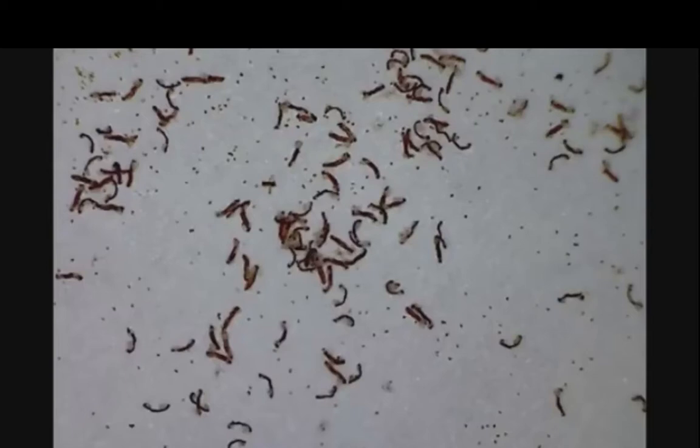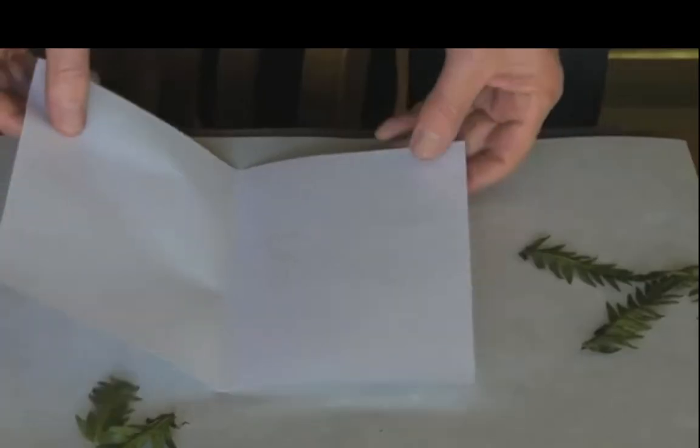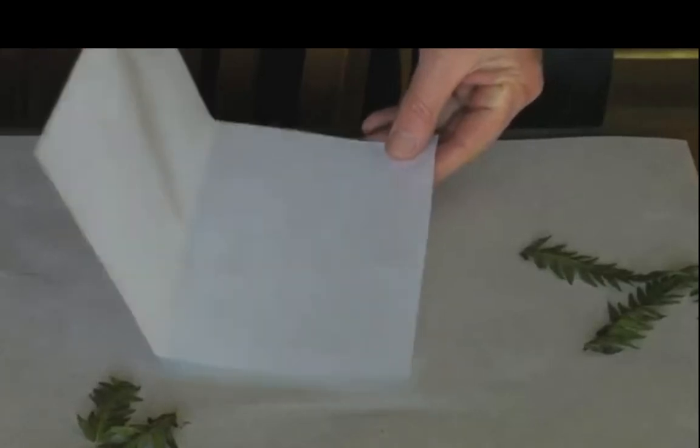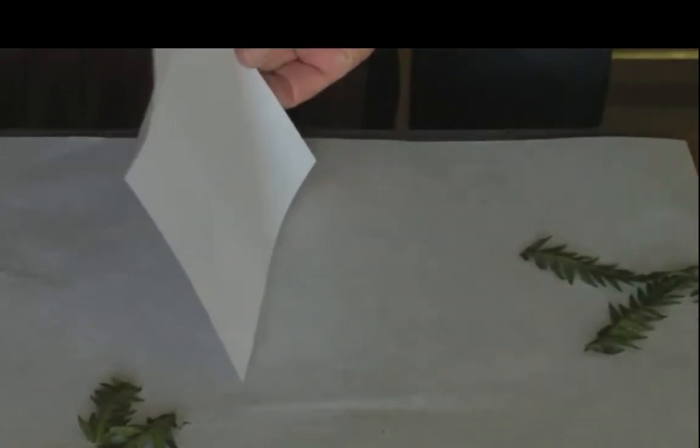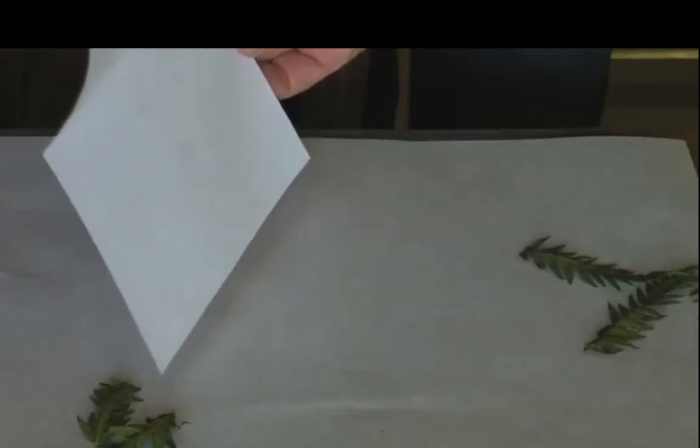Now if you look at the dust under a microscope, you'll see that much of it is spent sporangia, and we know that the sporangia are where the fungus, moss, and other spores might be, so we need to get rid of it. We eliminate those contaminants by taking the paper, shaking it a bit, and then tilting it to let the chaff run off. If you do it right, you'll end up with something like this, where the sporangia are gone and you're left with just the spore.